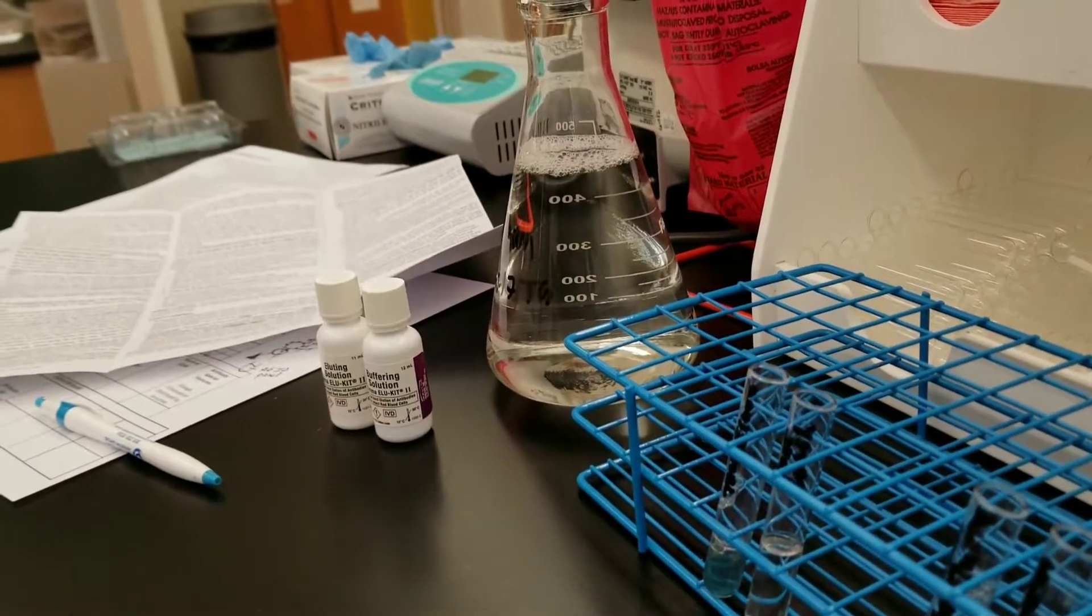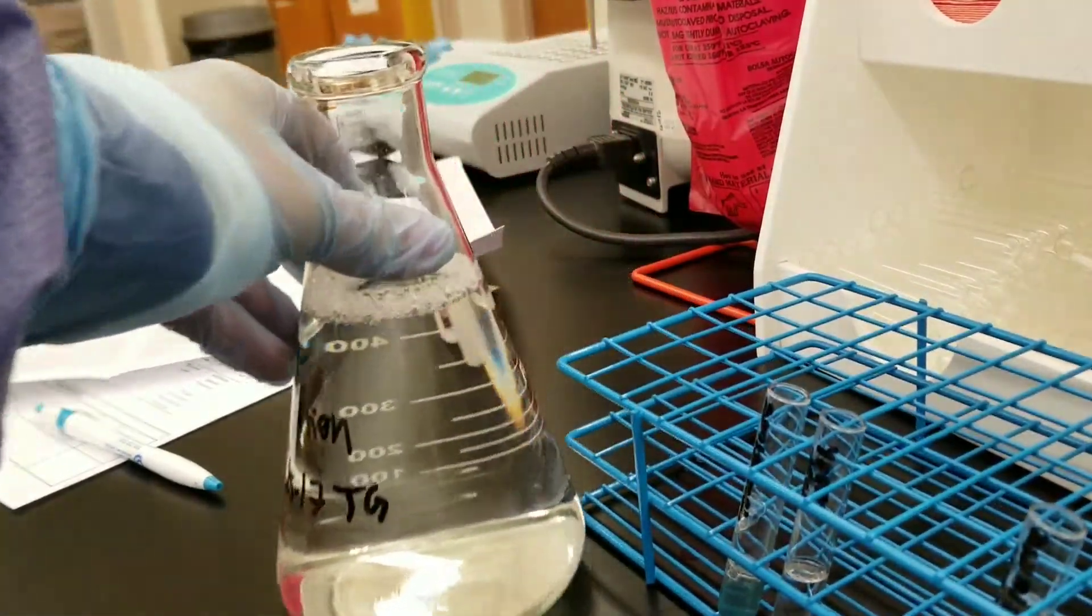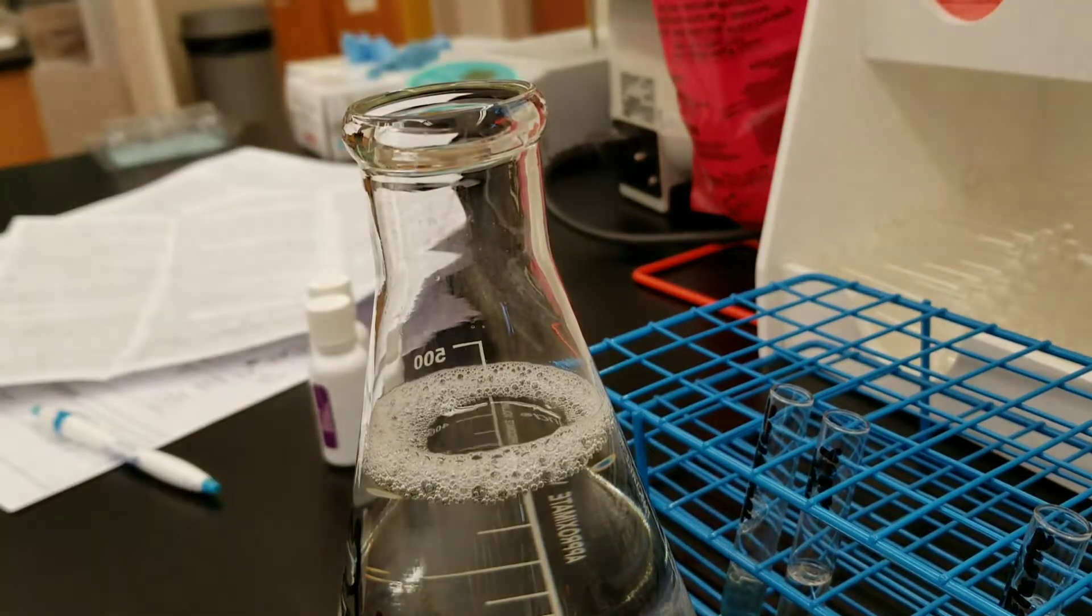We just finished the elution testing and I want to make sure that you see what I do with this. I got a large piece of parafilm.